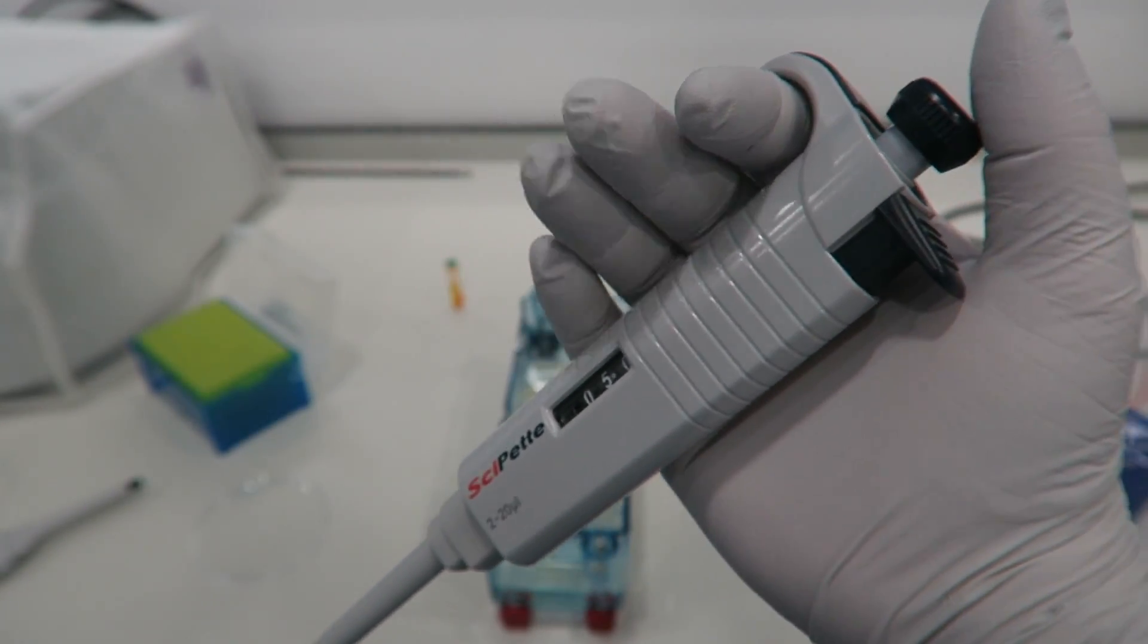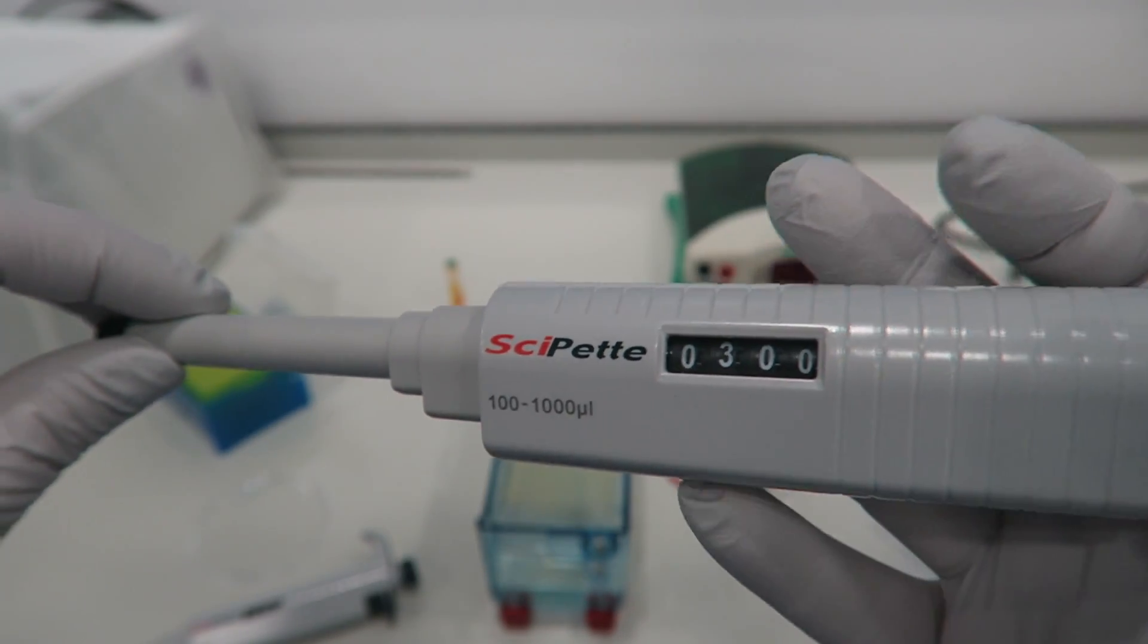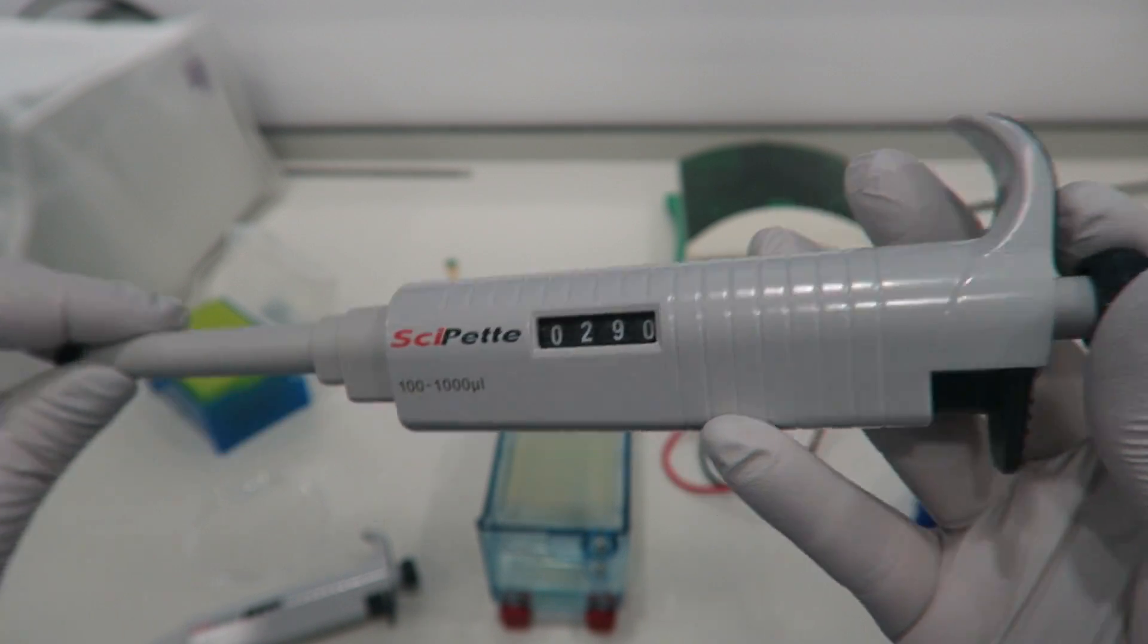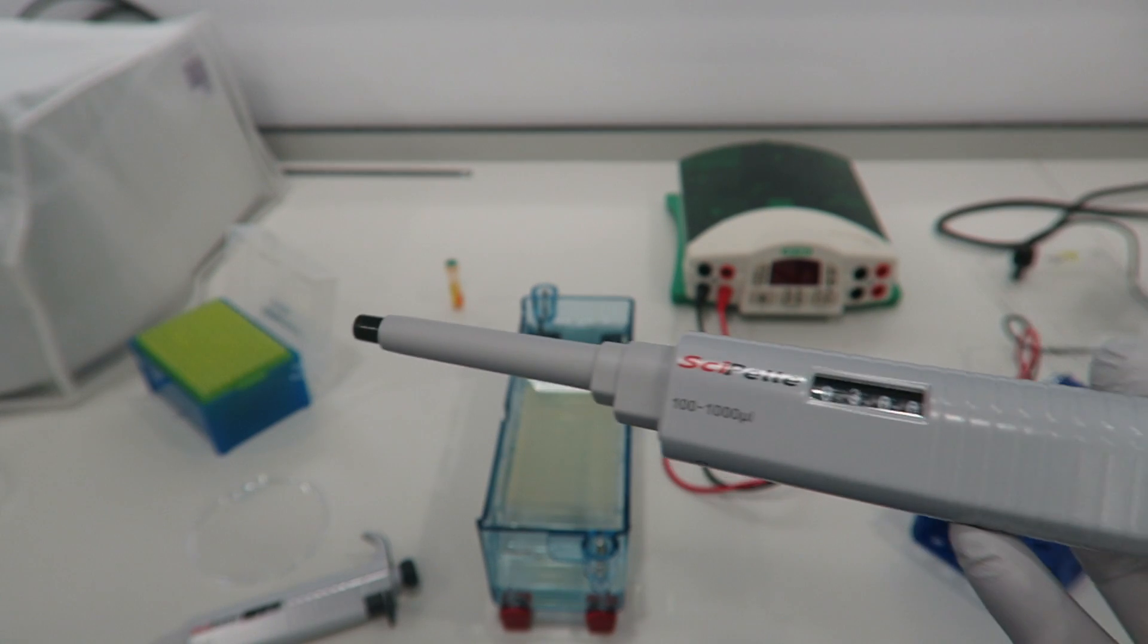Holding it securely. This pipette will hold between 100 and 1,000 microliters. These are set at 300 microliters.